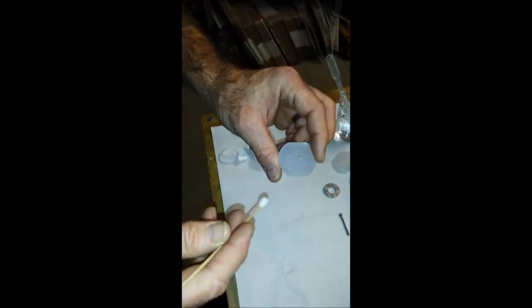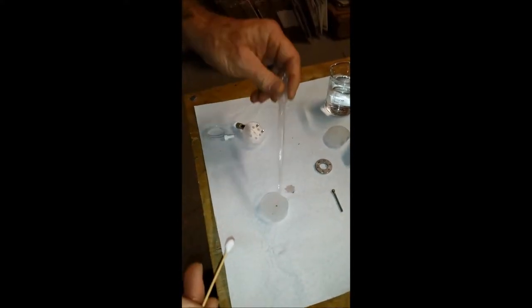Go over the cleaning of an amperometric flow cell. You see on the bottom you have what's called the working electrode. There's two ways to do this.